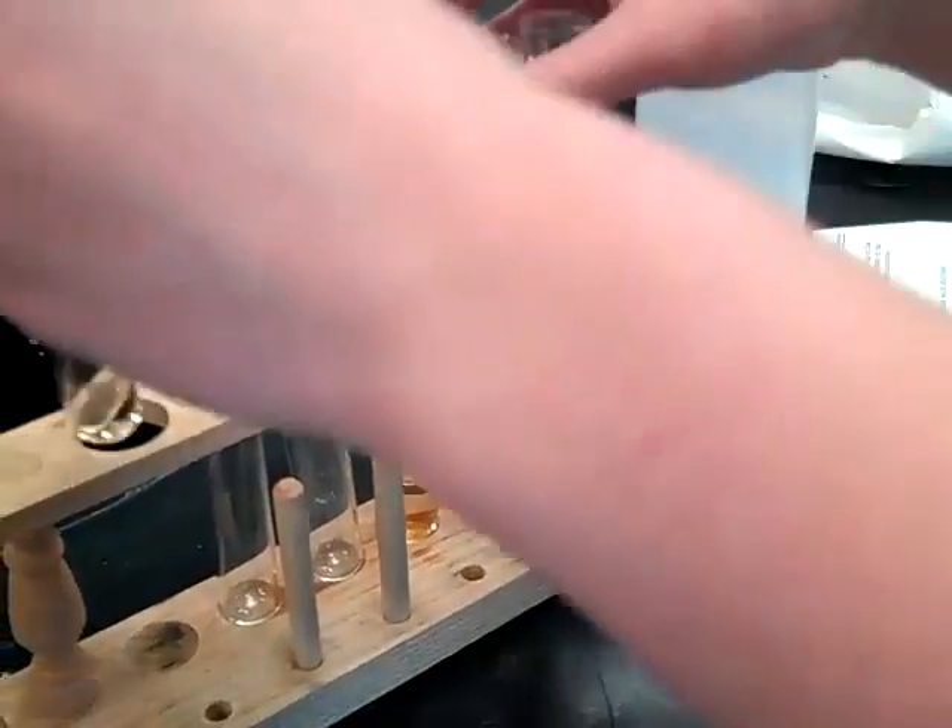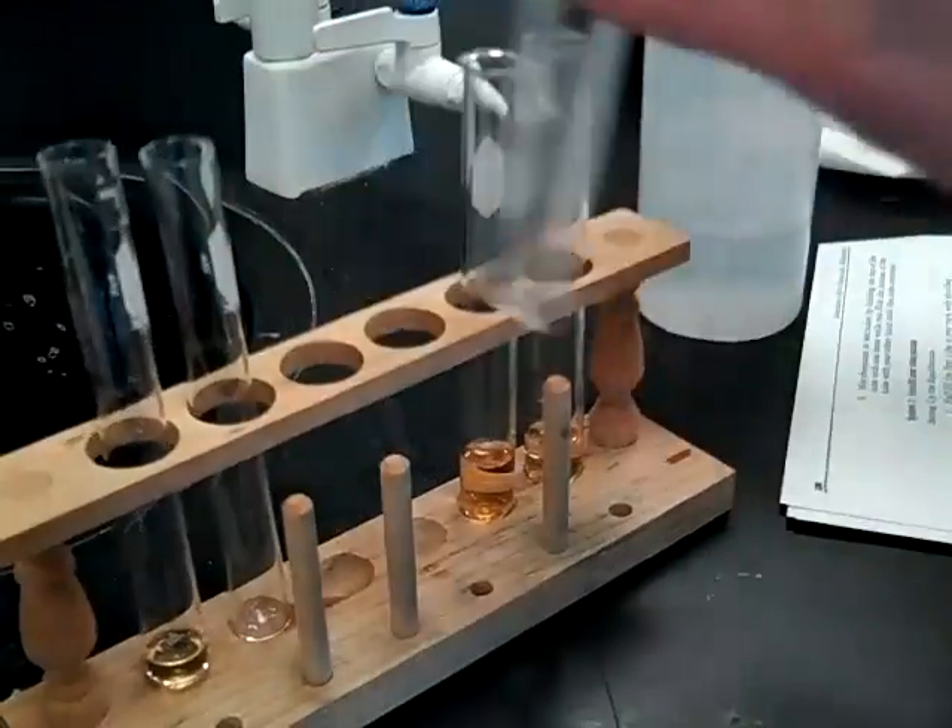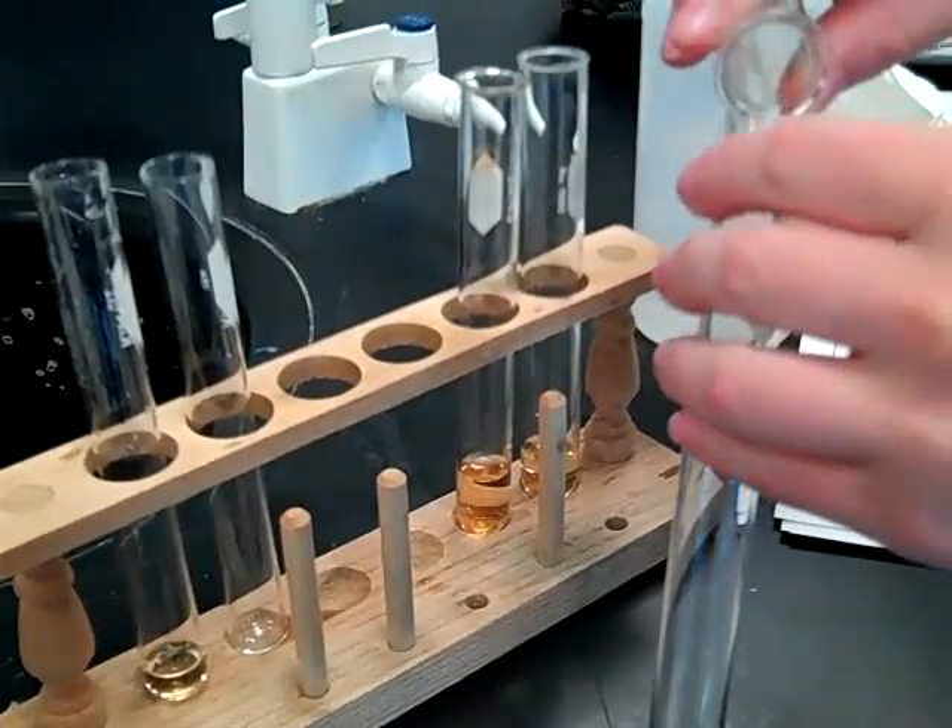That's good enough! I'm also still in the middle. So, it starts to go up.